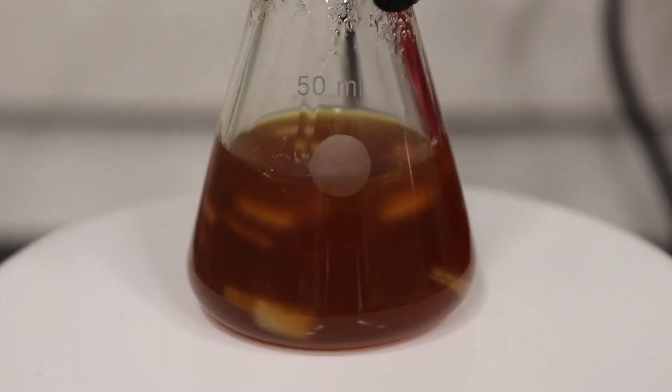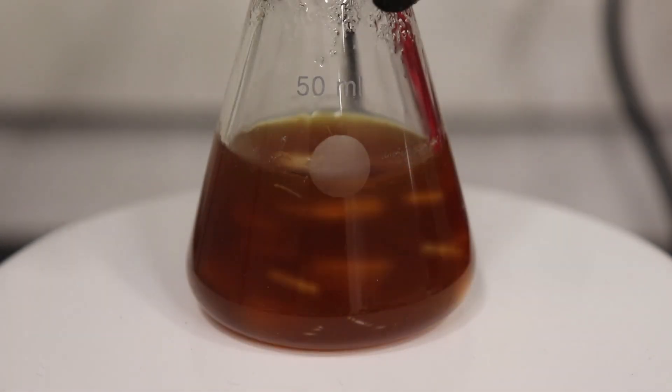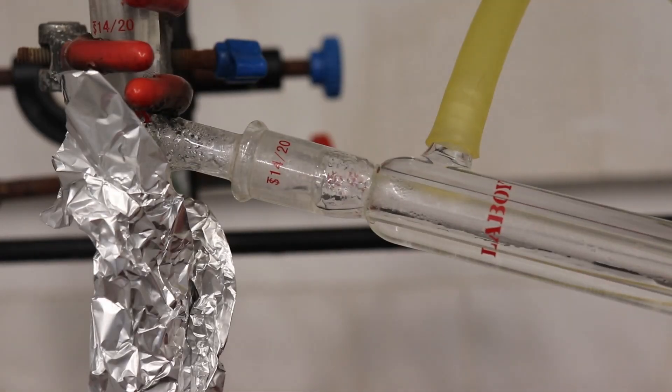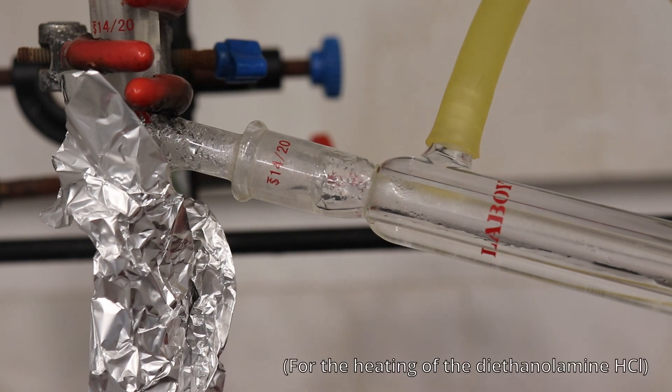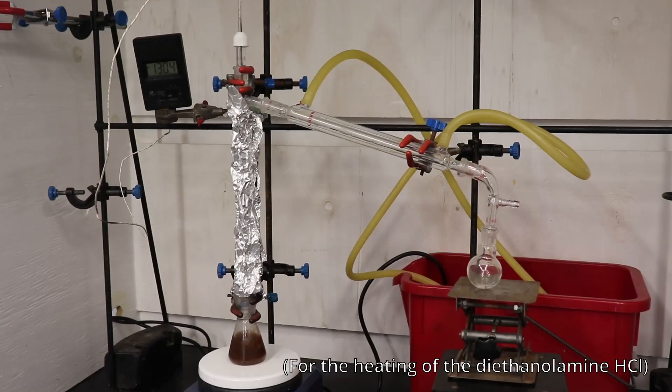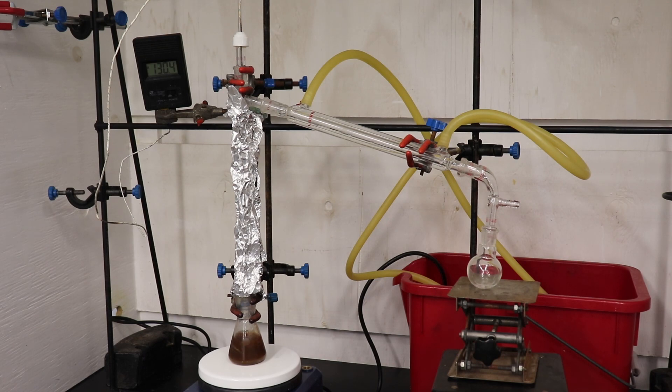The burnt smell of the crude product has also been removed, leaving it with the typical fishy amine odor. On a previous run where I was able to maintain the 200 to 210 degrees Celsius heating range, I was able to reach a 48% yield, which was identical to the yield from the literature procedure.